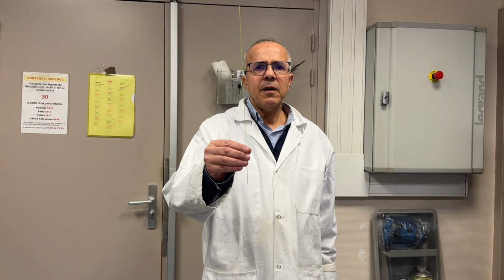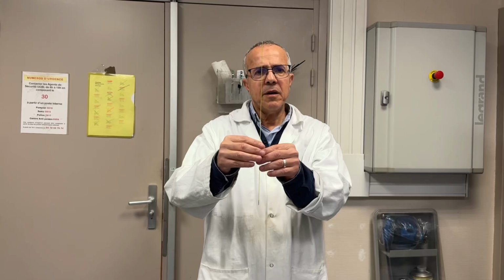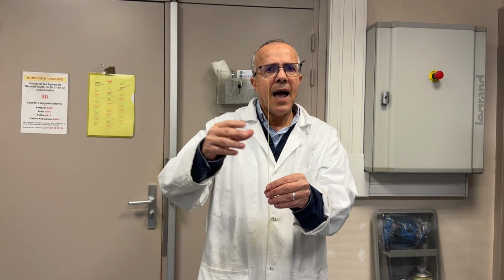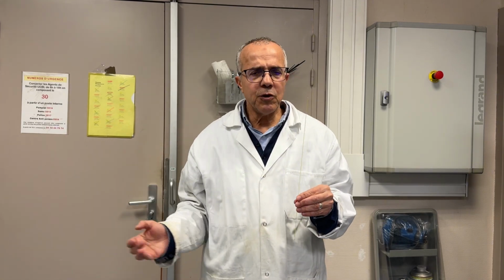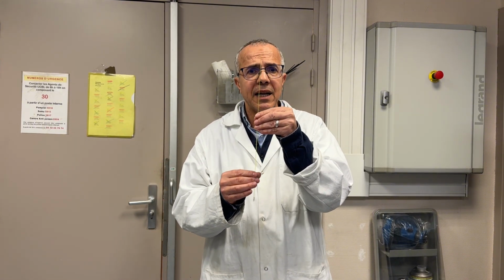This is a sample fiber grown by the micro pulling down technique. It is YAG doped with cerium. The longest is about half a meter, and this fiber takes 1 day to grow. You see the color is yellow. It is doped with cerium. And later I will explain to you the technology that we are using. It is micro pulling down, and the different steps that we use until we get a fiber like this.